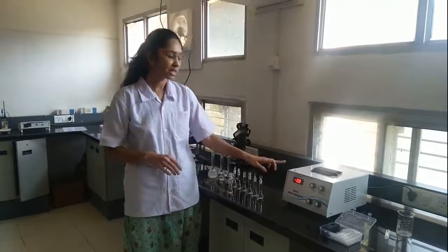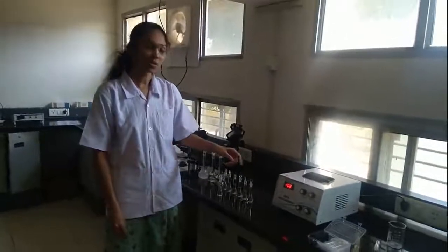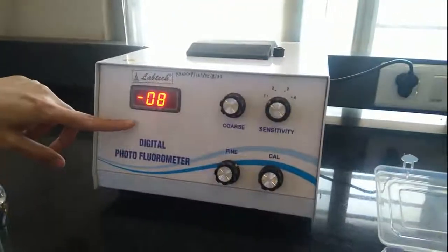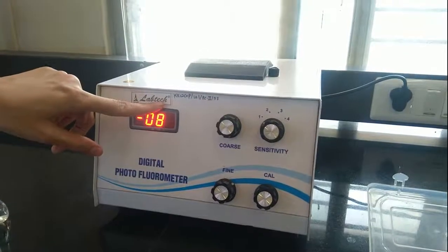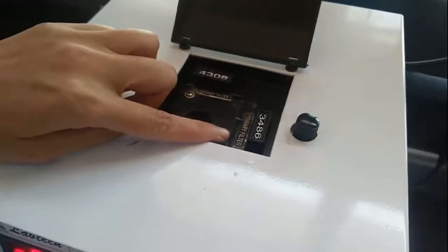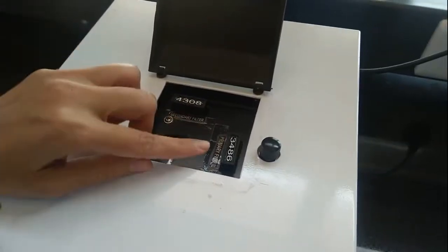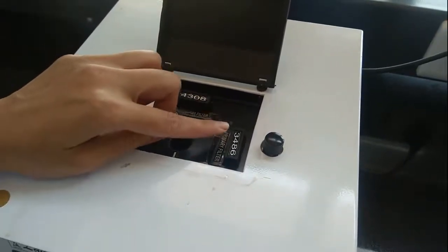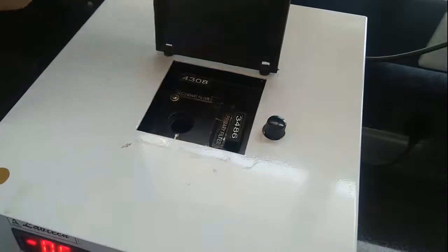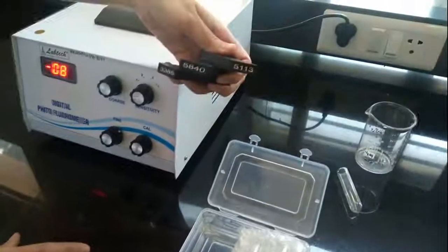Now we are going to see how to perform estimation of quinine sulfate with the fluorometer. This is the digital photo fluorometer — Lab Tech is its make and model. The fluorometer contains two types of filters: primary filter and secondary filter, that is excitation and emission. For estimating quinine sulfate, we have used primary filter 3486 and secondary filter 4308. Various other filters are available — which filter to use depends on our sample.